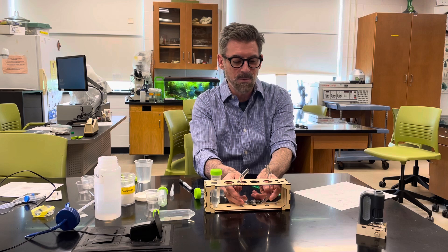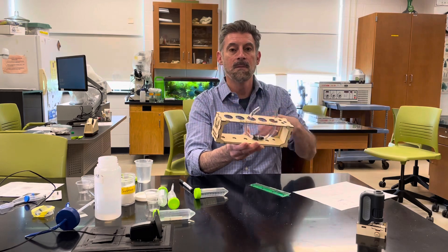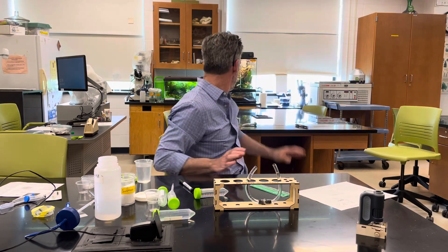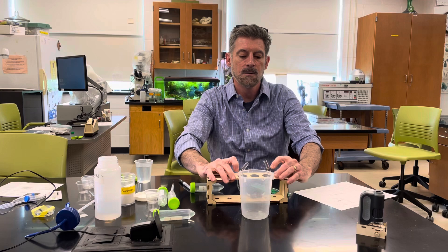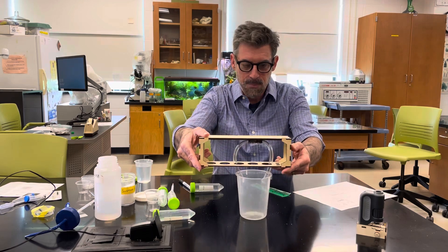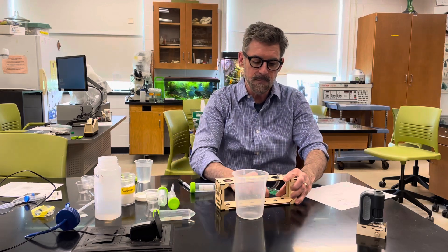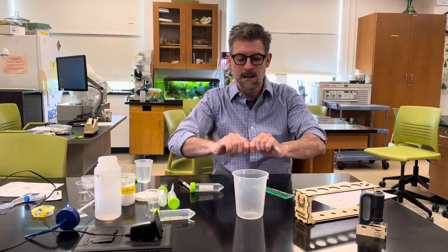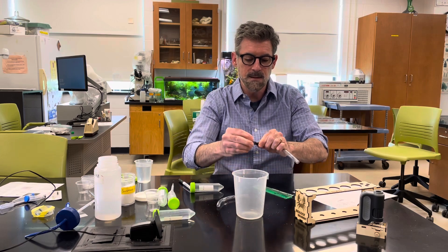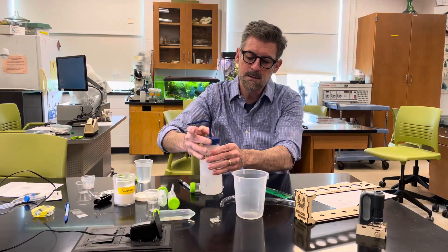After 24 hours, rather than pulling the tube out and spilling, I recommend taking the whole test tube rack to a sink and dumping it there. Disassemble the U-tube, dump out the liquid from both sides, and discard that piece of dialysis tubing. Rinse out your tubes — because of the sugar it'll be on both sides.